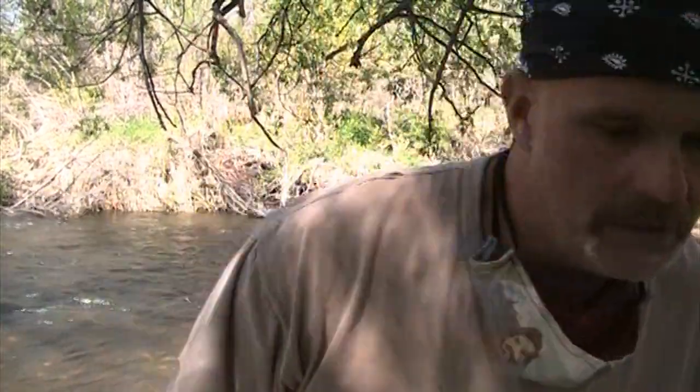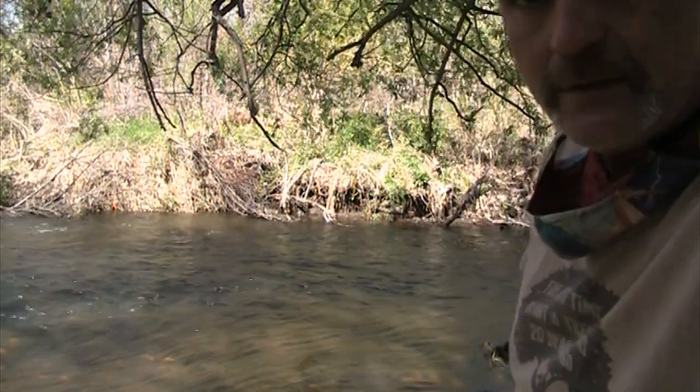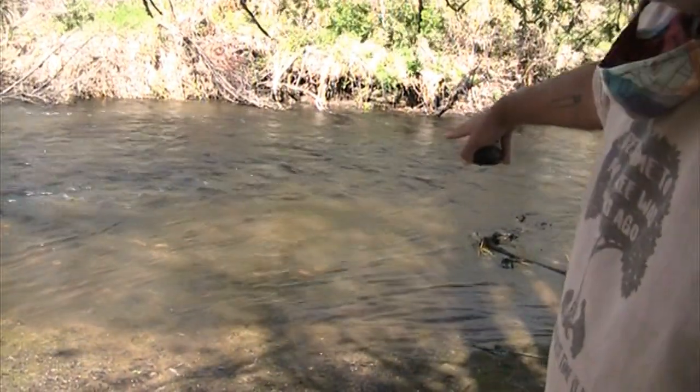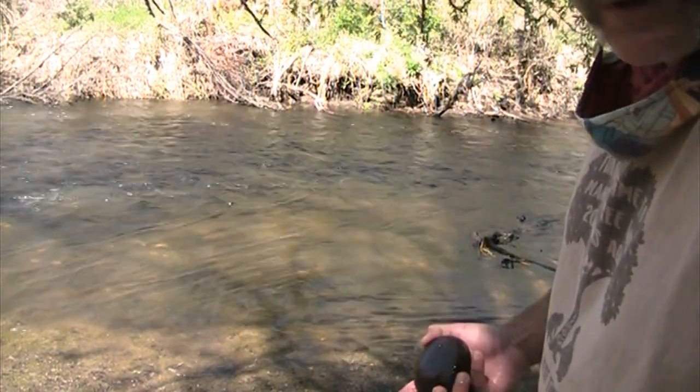But next I'm going to show you how to measure for invertebrates. So this is something where you want to do it when the water is moving a little slower. But since there's not students watching, and also because I found a section of the river where right here is actually a little eddy where it's slowing down, I'm going to pull out some rocks to look for invertebrates.